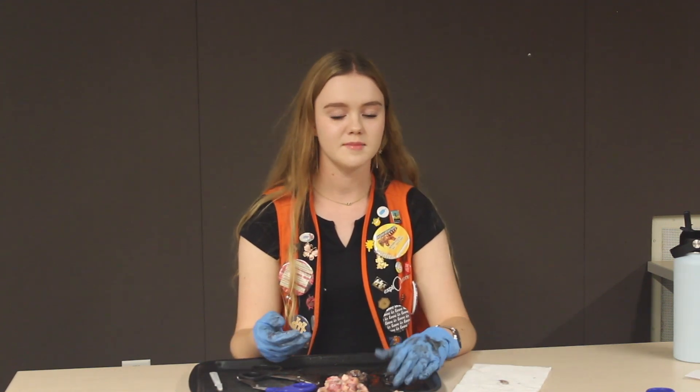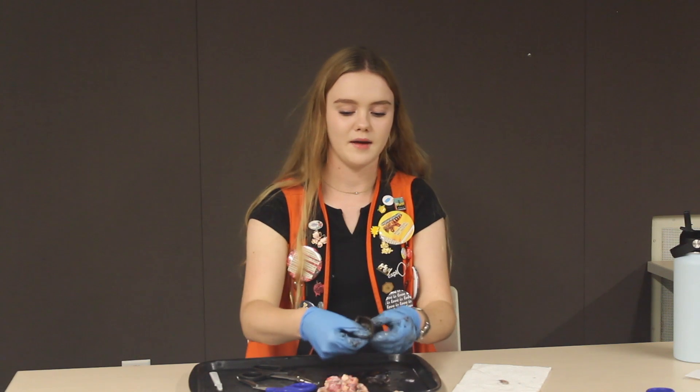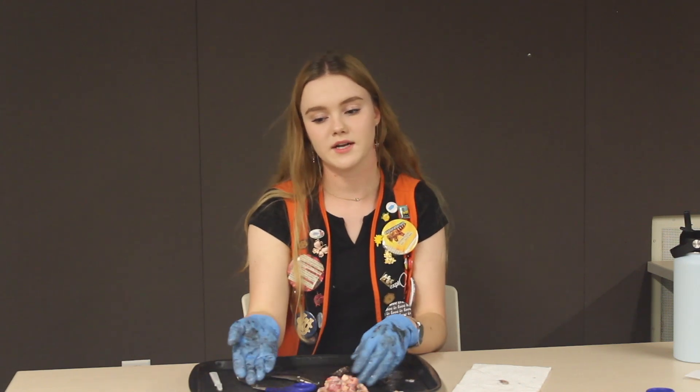When you're done with your dissection, I like to ask visitors if they have any questions. You can thank the crowd for coming and watching. Sometimes people will come up and get a better look at the parts or want to touch things. So that pretty much concludes the dissection — thank you guys so much for watching. Bye!